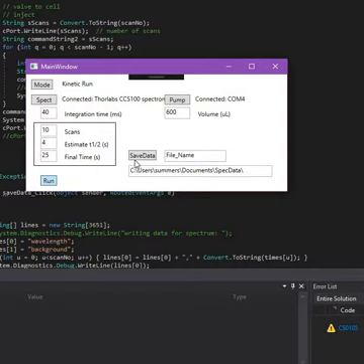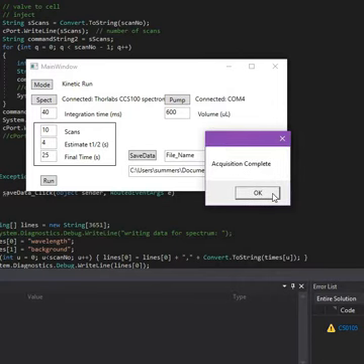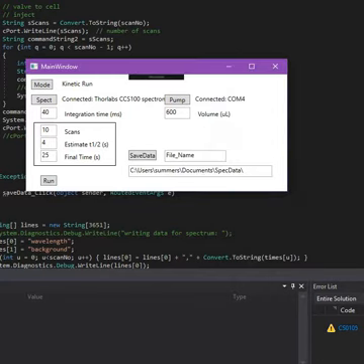You could hear in the background the sound of the valves and the motors turning, and that had the effect of injecting our solutions. Once the solutions are injected, there will be spectra acquired at different data points, and it'll acquire until 25 seconds have elapsed. That says our acquisition is complete. We'll hit the OK button.